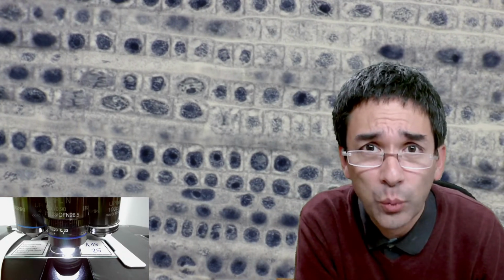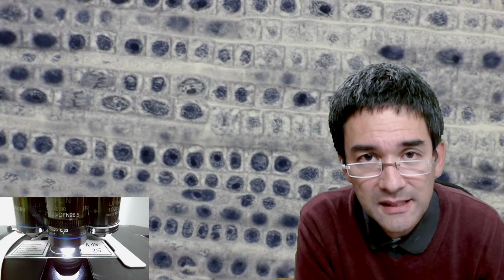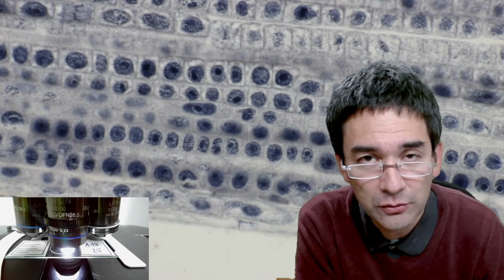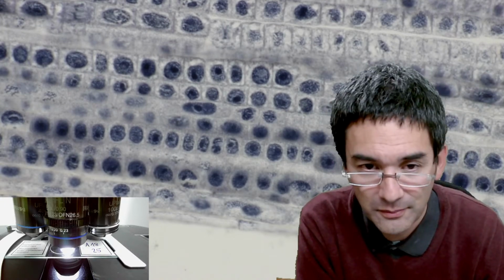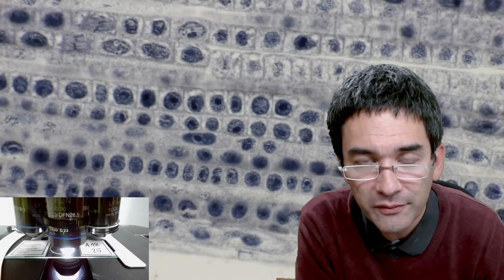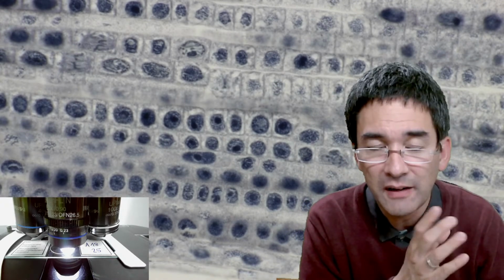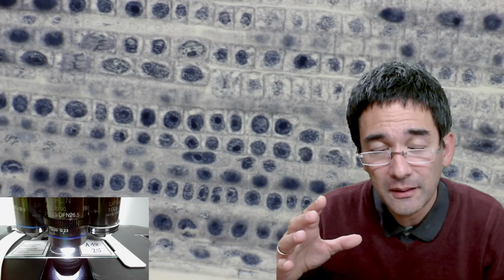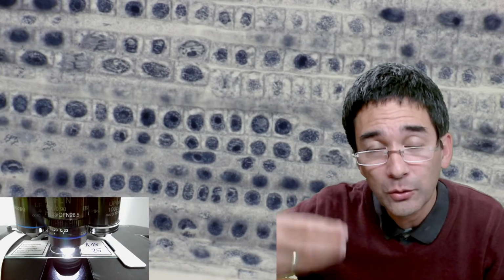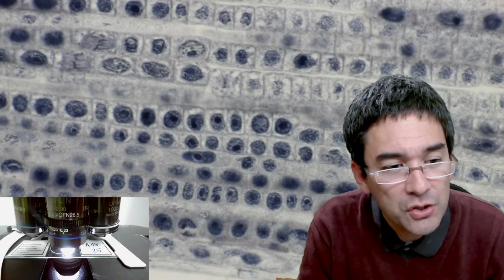I heard and read once, correct me on that, that the cell cycle of fast dividing eukaryotic cells is around 2 or 3 hours. This is what I read somewhere. However, what happens in reality is that the cells might start dividing, and then they might stop somewhere in the cell cycle and wait until the conditions are right to divide. Not a very satisfactory answer, so I want to show you the following.